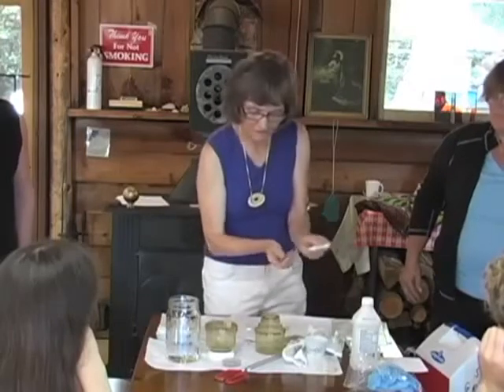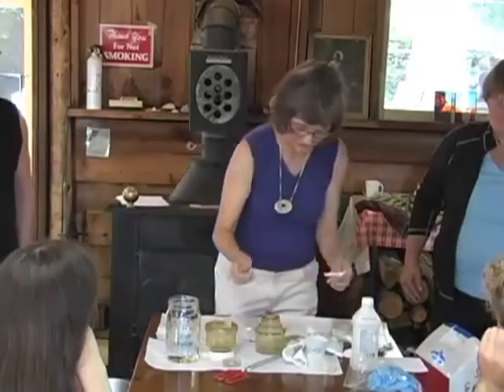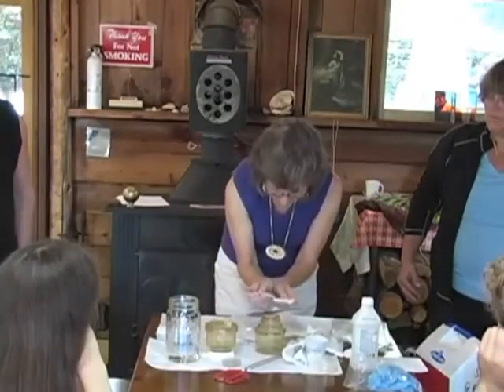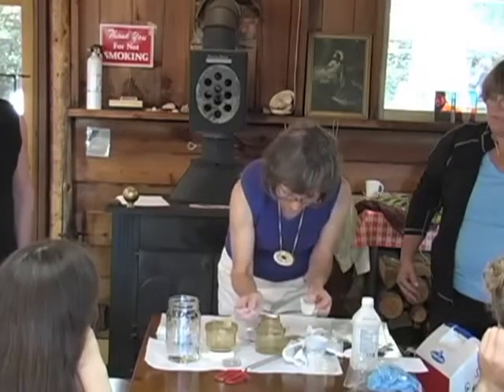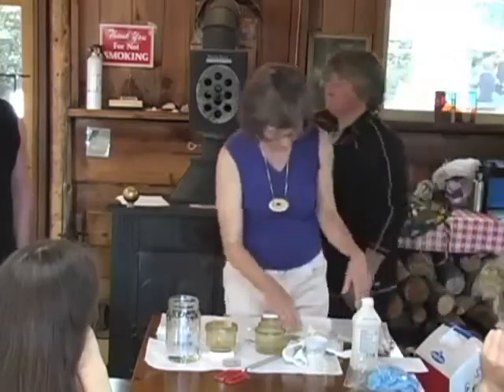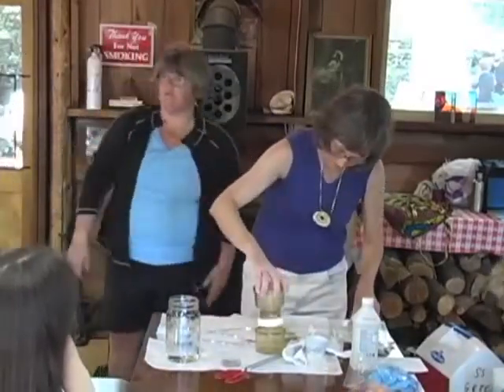There's the grid. It's very, very faint. See, here the grid you can see really well. So I thought I was missing a piece. Okay, so this is going to go right. I can just get this. Be sure to place paper grid side up with no wrinkles. Yep, that's what we want. Okay, so when things are packaged sterilely, it's not uncommon to have a blue field that represents one that you can touch and others you can't.